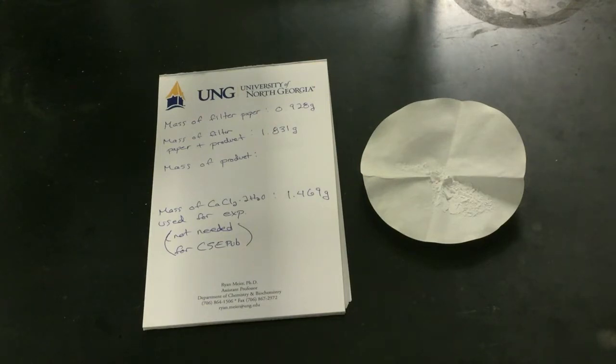It's not going to be 100%, but like I said, it's almost never going to be the case for these reactions. There are a number of reasons for that, in terms of things that can go wrong or places we can lose product. One of the biggest ones is usually the filtration step. We mentioned that probably some of that product slipped through the filter paper. We could see a little bit of white color in the filtrate at the bottom, so we probably lost a little bit of product there. And it's also rare for reactions to go all the way to 100% completion to begin with. So I think the percent yield when you calculate it should still be pretty good.